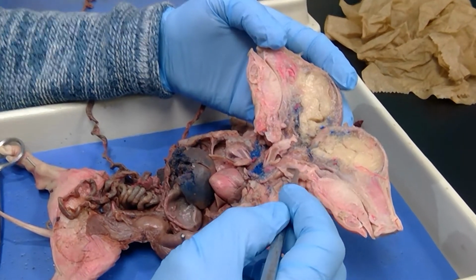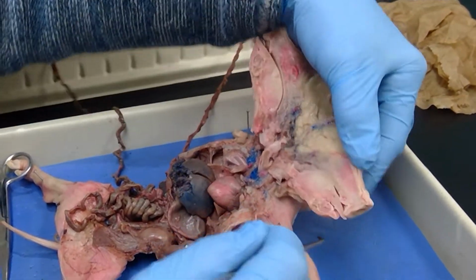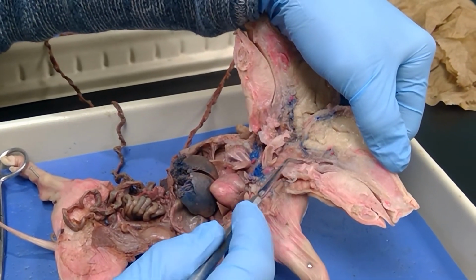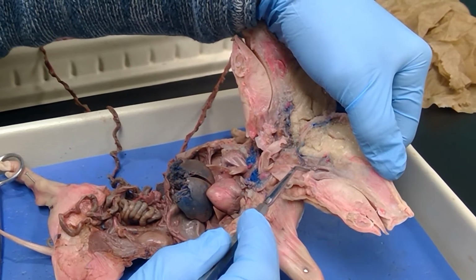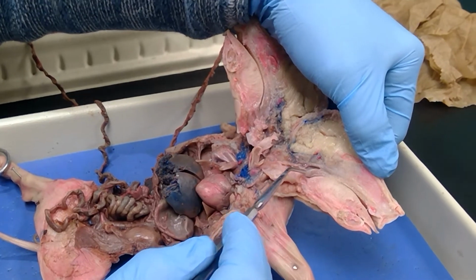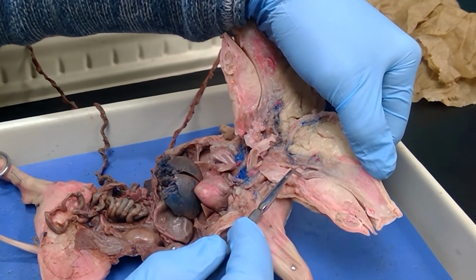So it's not a very good specimen for that. This right here, let me turn this head this way. This right here is a good pharynx region. This is the nasopharynx here. This is the oropharynx. This is the laryngopharynx. And this is the epiglottis, but it got cut in half and it's not that great of a picture, but that's it right there. That's the epiglottis.